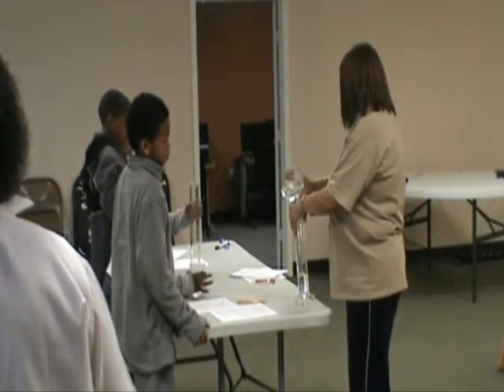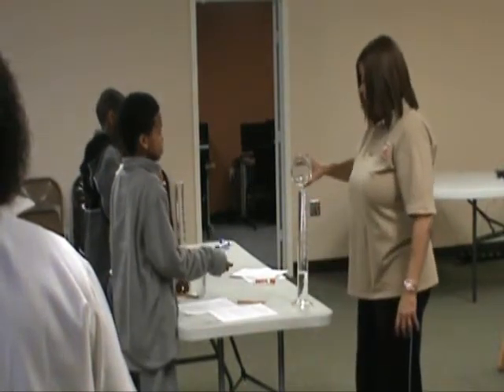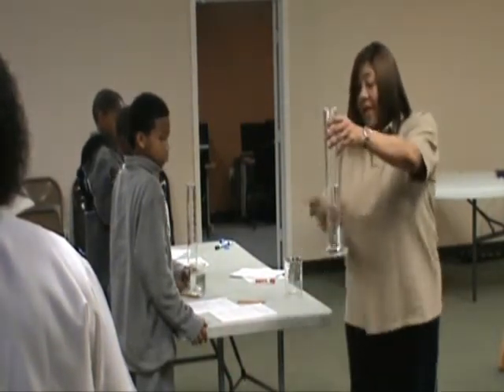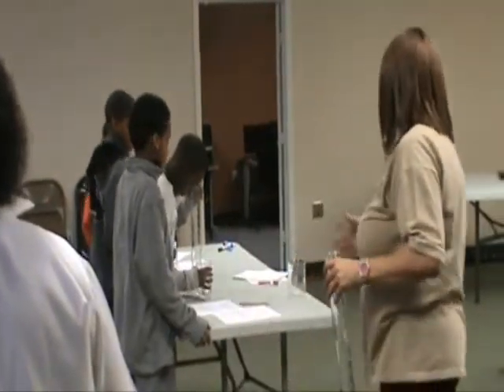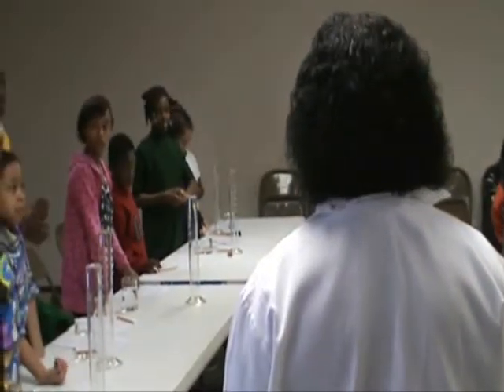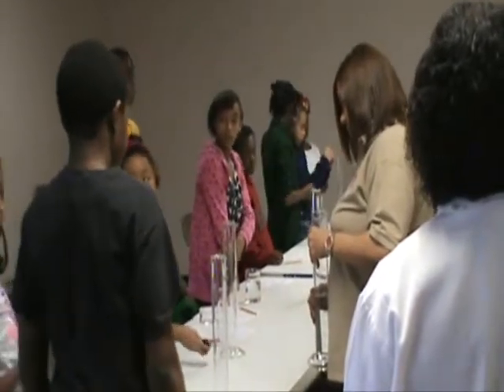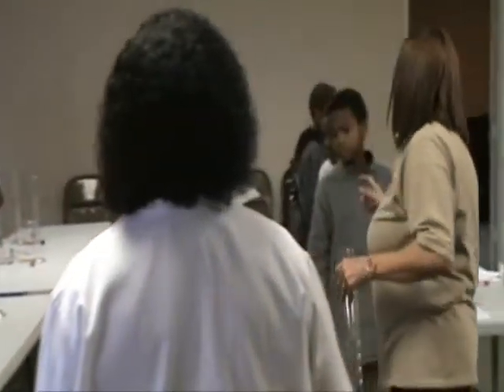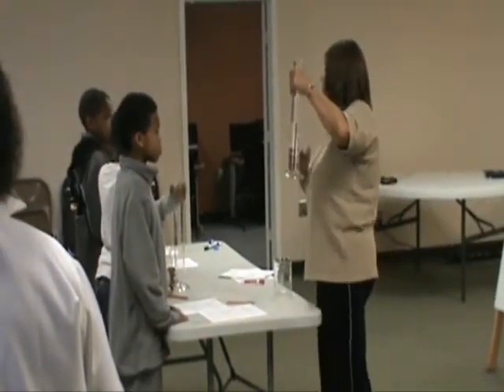But why are we doing it this way? Why are we tilting it? If I just pour it in here like that, what's going to happen? Not just spill, but what am I introducing? What am I bringing in? A lot of bubbles. Do we need air bubbles? Why don't we want bubbles? What's inside a bubble? Air. And does air take up space? So it has space, right? And then our volume would not be perfectly accurate.